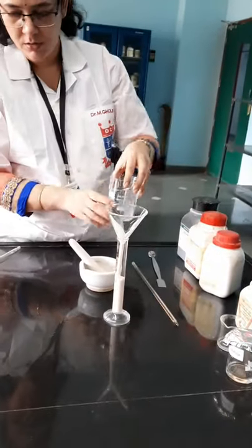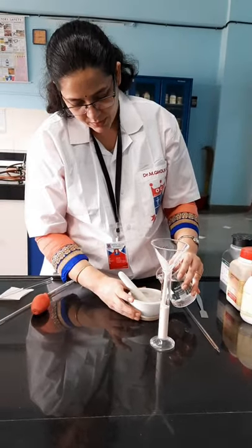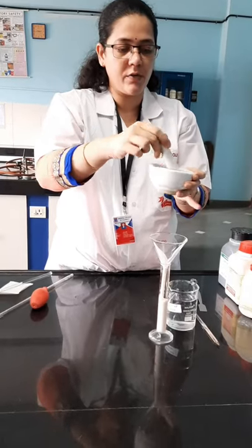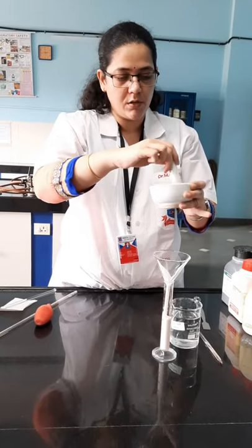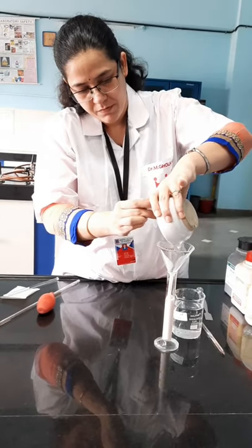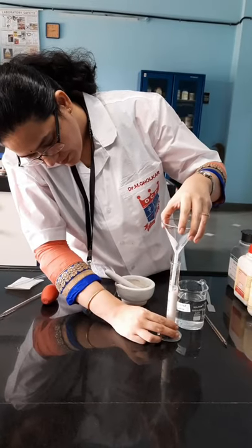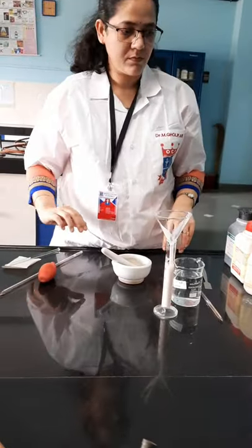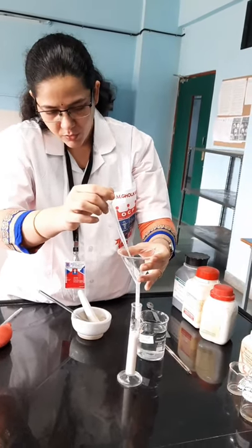Now I will add some water — be careful to add only a little bit of water every time; you should not exceed the stated quantity. To ensure that the entire content of the mortar has been transferred, I will add water to the mortar and then transfer it to the measuring cylinder, leaving enough quantity to make up to 20 ml.